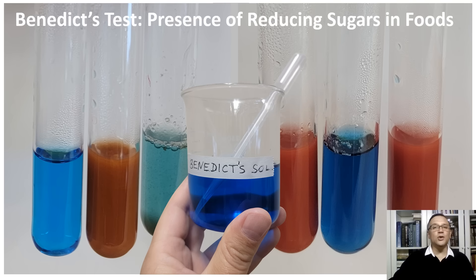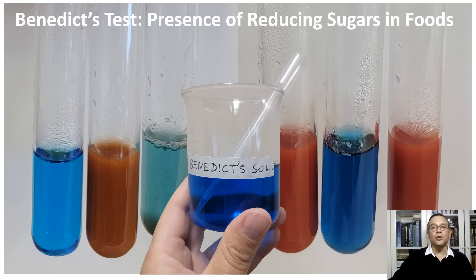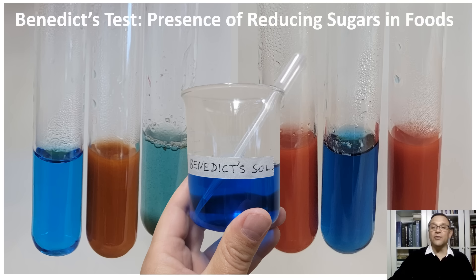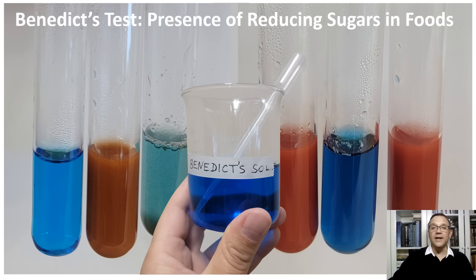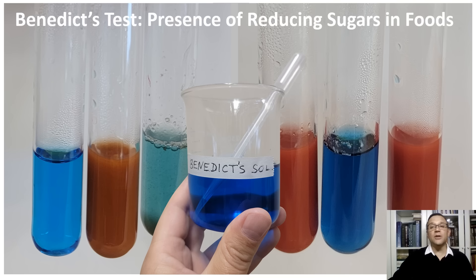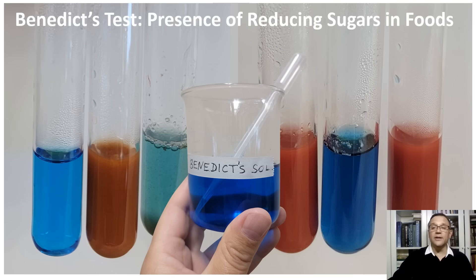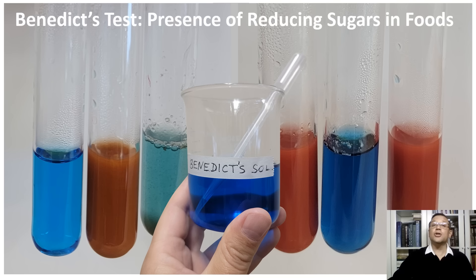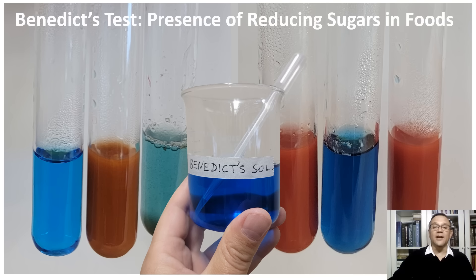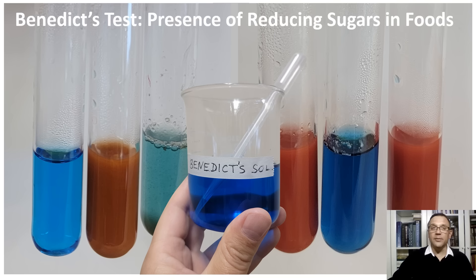The Benedict's test is widely used as a chemical assay for detecting the presence of reducing sugars in a sample. This qualitative test relies on Benedict's reagent, a blue solution containing copper sulfate, which reacts with reducing sugars when heated. The reaction produces a color change indicating the presence and approximate concentration of reducing sugars such as glucose and fructose. By observing the resulting color, ranging from green to red, one can determine the sugar content in various food samples.